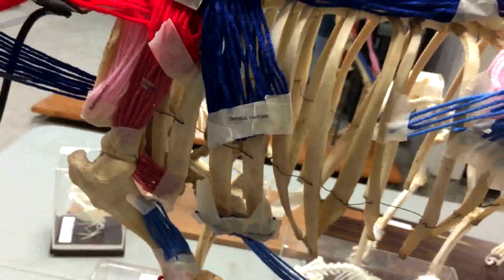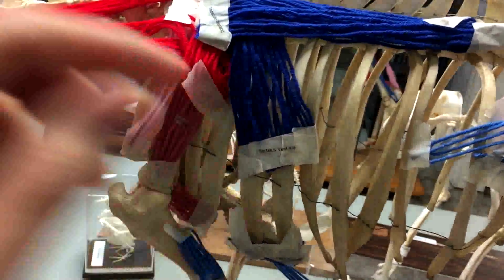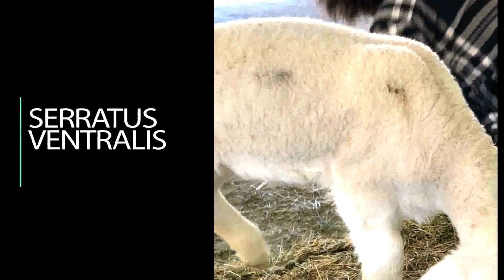The serratus ventralis muscle is attached to the ribs with finger-like tendons. The function of the serratus ventralis muscle is to move the scapula and help raise the ribs.